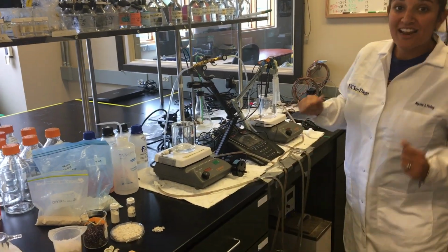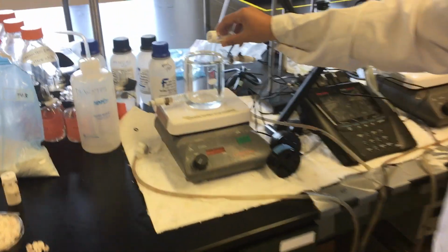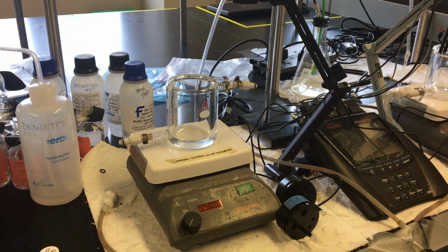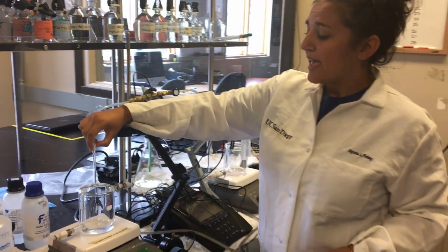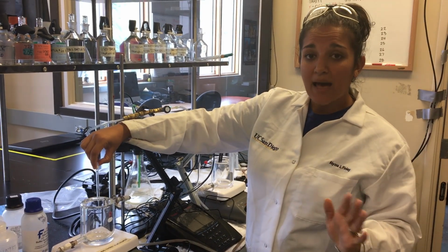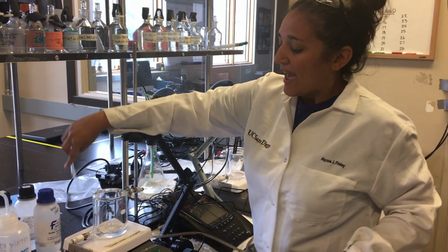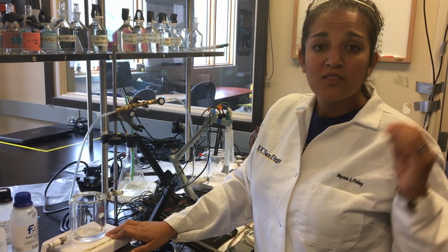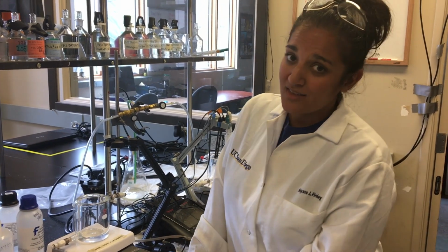So the experiments that I do in the lab is I take a little bit of these sand samples and I put them in my beaker, and then I take seawater and I put it over the sand in the beaker, and then I take these little pipettes and I actually bubble CO2 into the seawater, and that artificially drops the pH, which is the same thing that's happening during ocean acidification, just on a much smaller scale and in the lab. And then what I can do is I can see how the sand reacts with the seawater, and I can take a sample at the beginning and at the end, and that'll tell me how much the sand has dissolved over the course of the experiment.